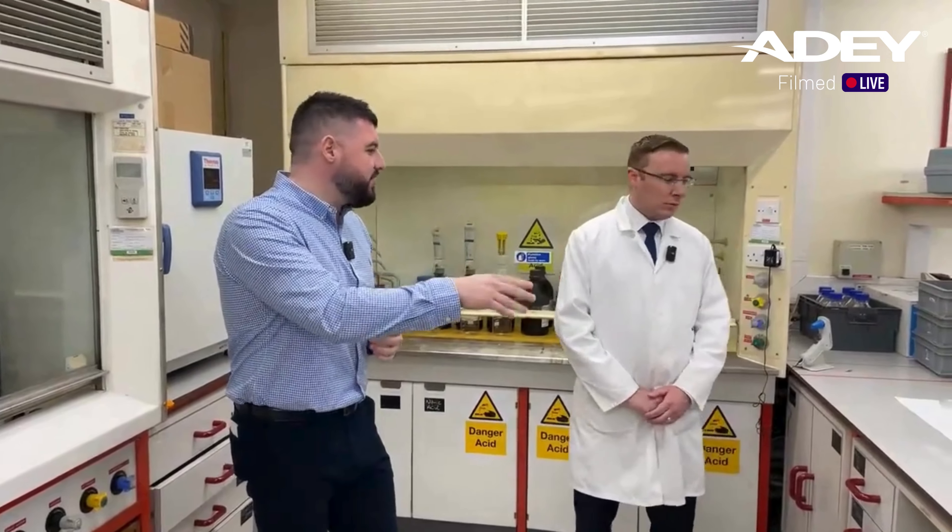I've had a really enjoyable day today having a tour around - really interesting stuff going on here, Josh. From a heat and engineering perspective, you may have seen the AD water test kits on the shelf - the domestic ones that you often see in the merchants. For me, it's getting that understanding of what exactly do we do here - what are we testing for, where does a sample go, what kind of things are we picking up on? Having that deep dive into water quality, because as heating engineers, most - probably all of you - have experienced water quality related breakdowns, sludge problems, all sorts of issues from bad water quality.